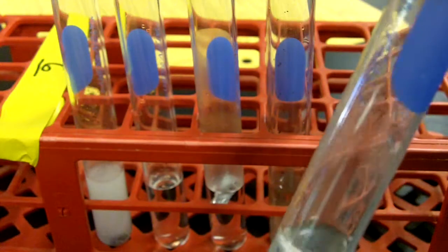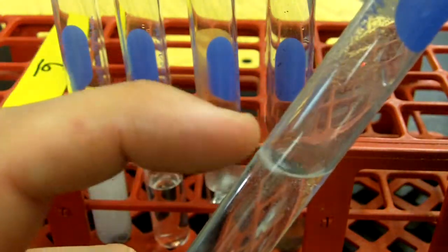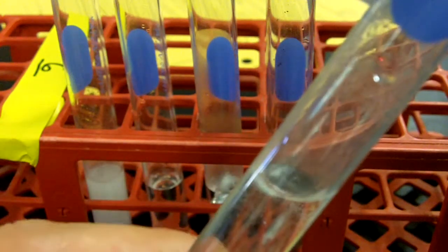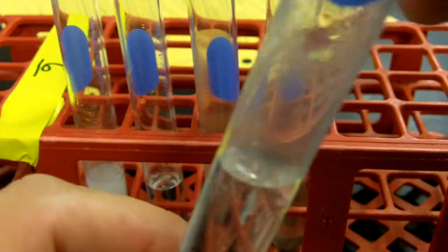Well, look at this, the magnesium, the last one we did, this one's moving pretty fast. So I hear the fizzing that's occurring. The magnesium is up at the top. You can see that bubbling action. So in talking about the other test tubes, this one here has gone through the reaction process and is near completed in terms of its reaction. And actually, it just stopped.